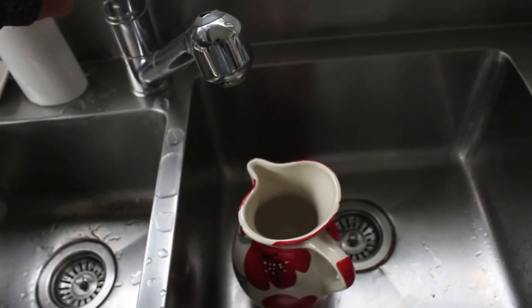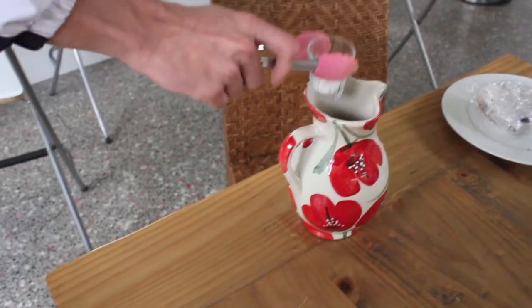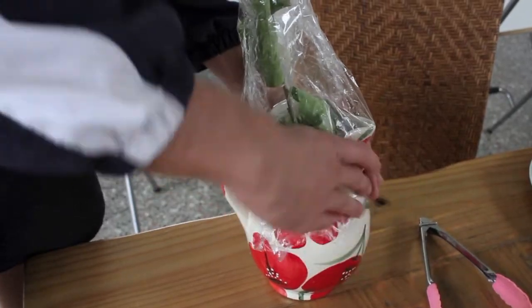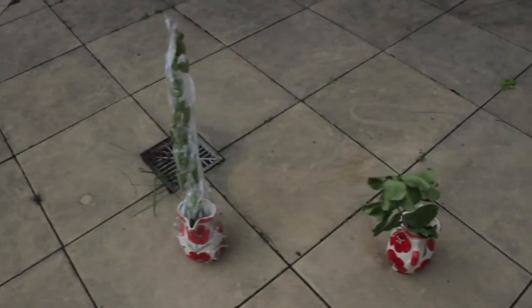The plant was initially left in a dark space for 48 hours to destarch the leaves. For the plant void of carbon dioxide, it was initially filled with water. Potassium hydroxide was then placed in this jug. Glad wrap was wrapped around this plant and secured tightly to the top of the jug. Control received the same amount of water. All plants were then exposed to the same amount of sunlight for 1 week.